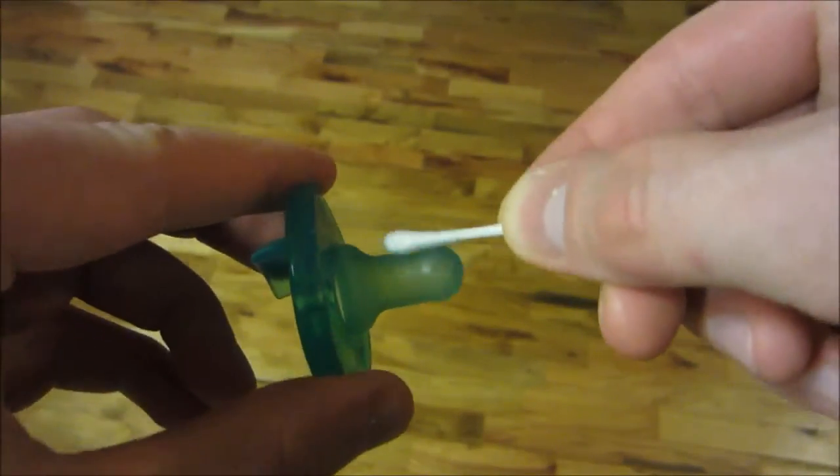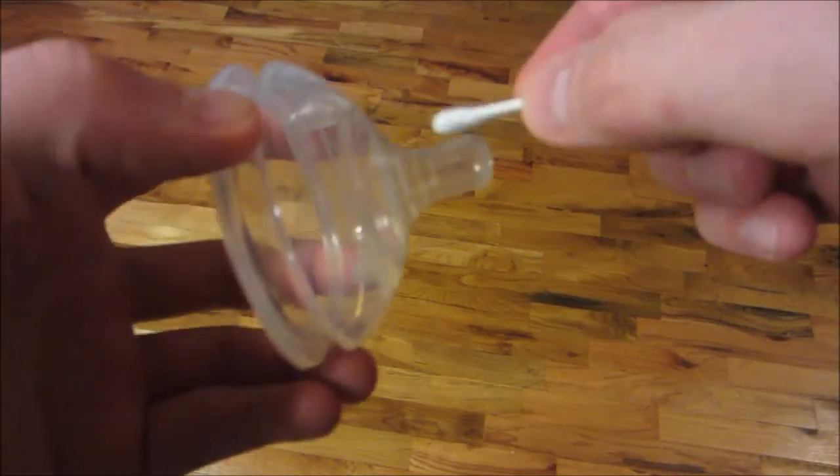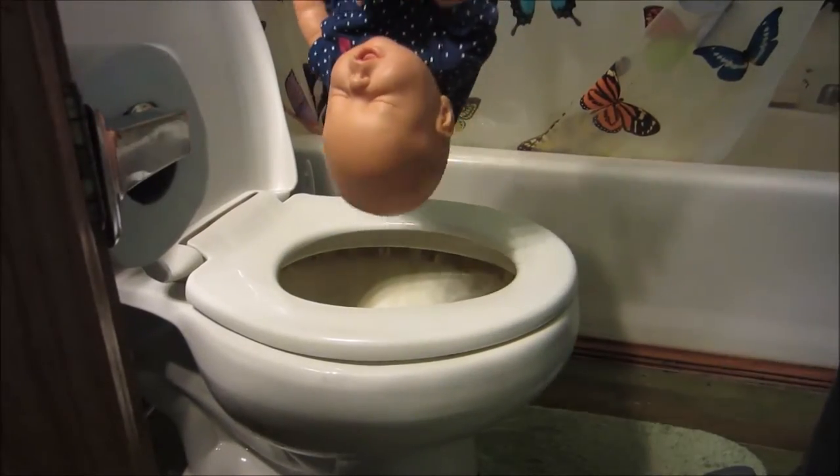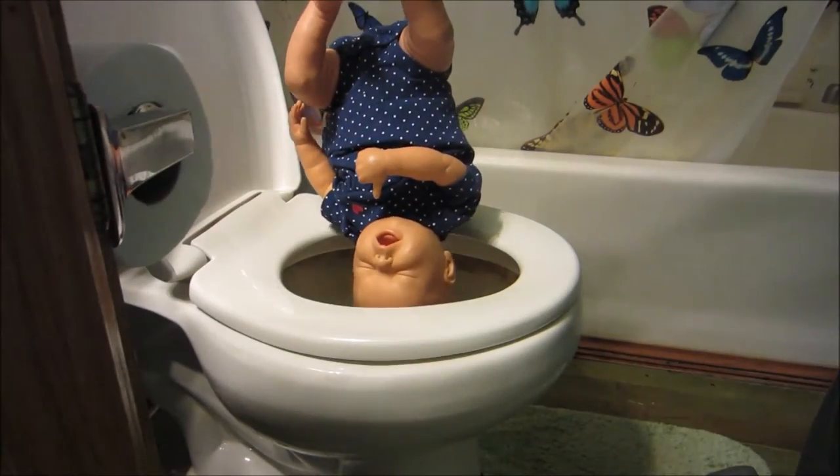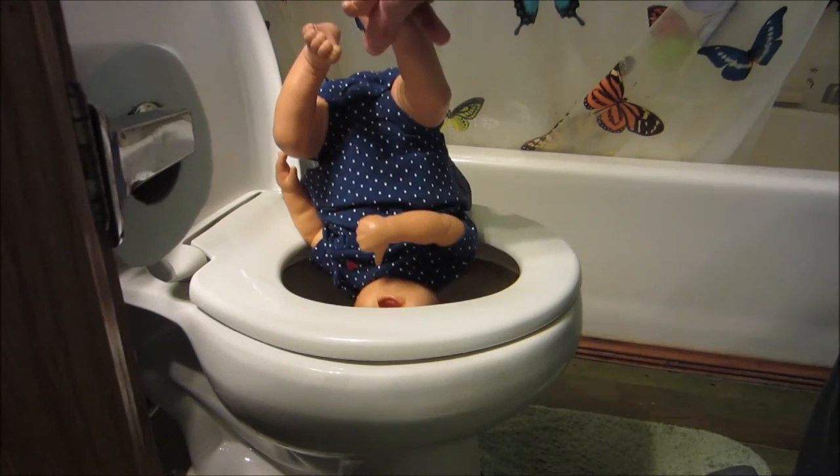The pacifier, after it's been washed and after it's been used. A used and a freshly cleaned nipple, as well as a nipple that has only been rinsed. And of course, a dirty baby's mouth.